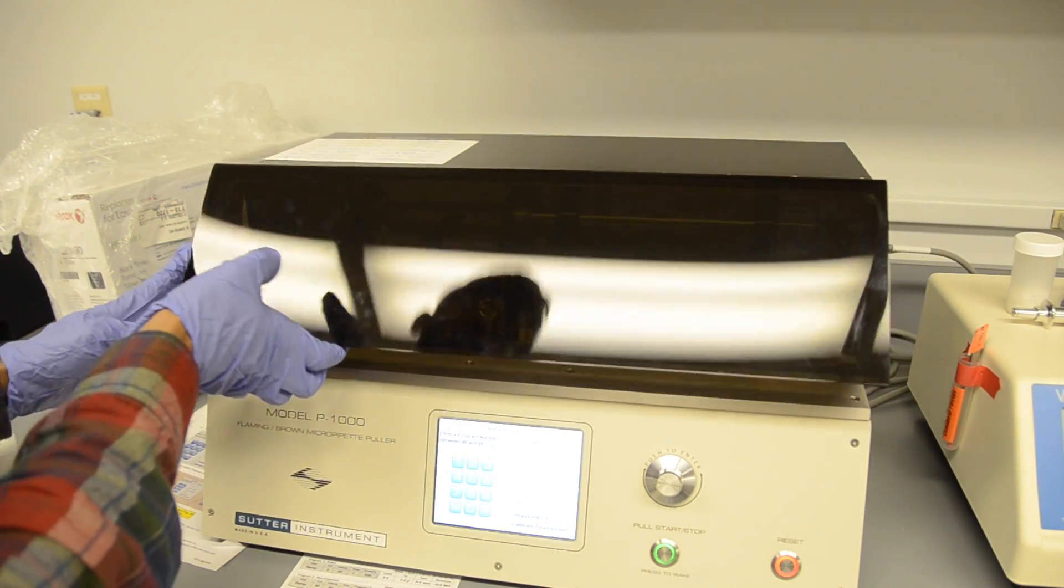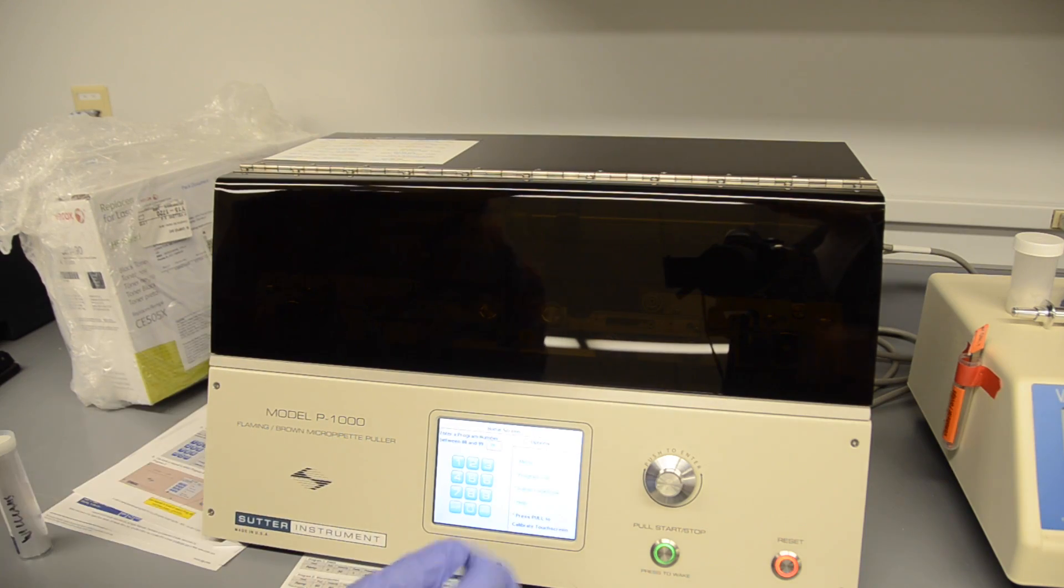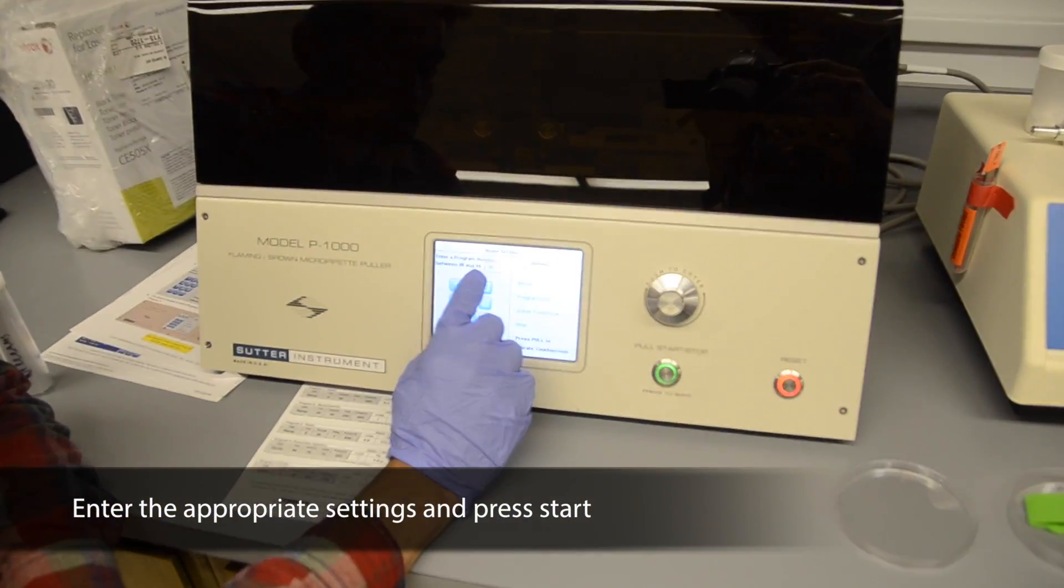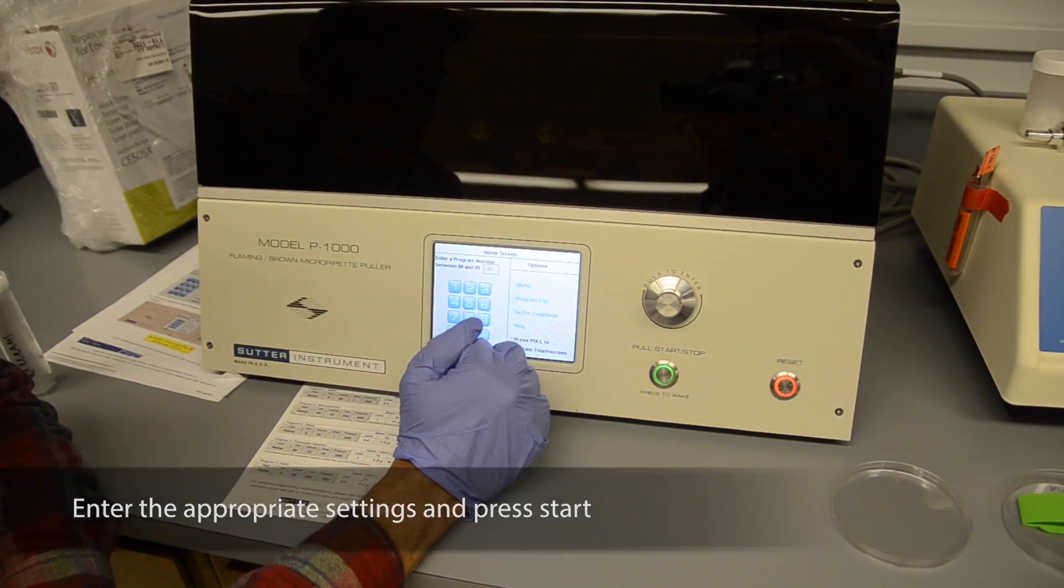Close the lid. Enter program number 6. Push the push to enter button and then press start to begin the pulling.